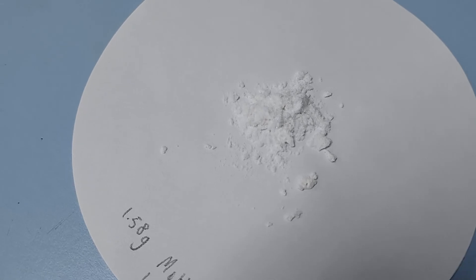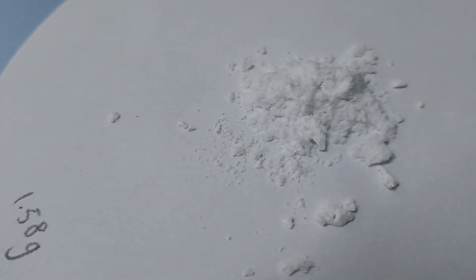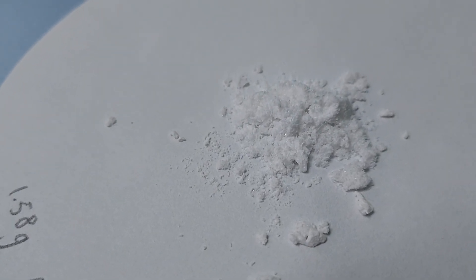Here's one that was prepared earlier. This one has dried overnight and you can see we have lovely white crystals. So we're going to perform the melting point on these.